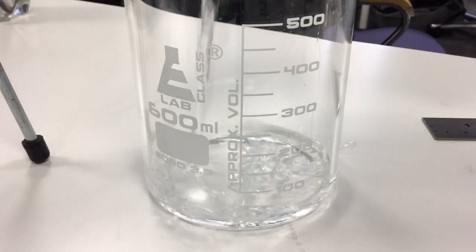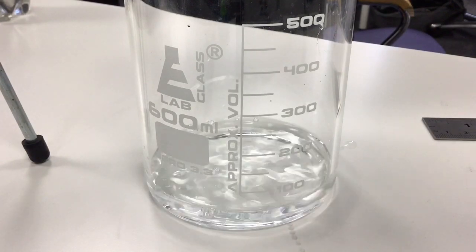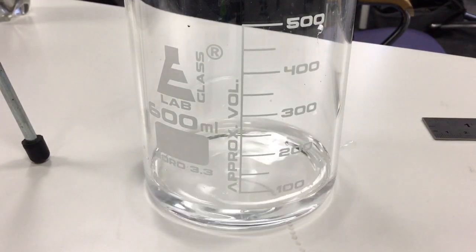We will measure a small volume of the water solvent into a beaker. This must be shallower than the one centimetre at which we place our origin line.